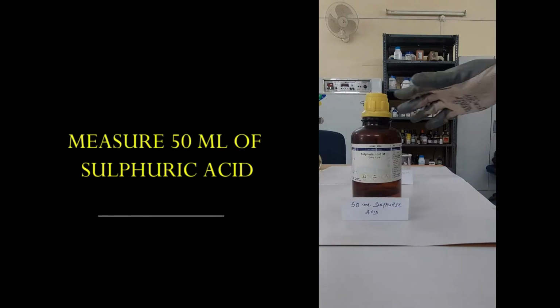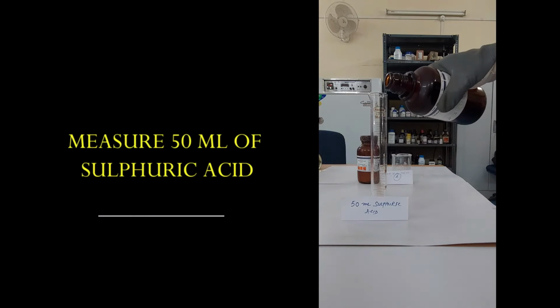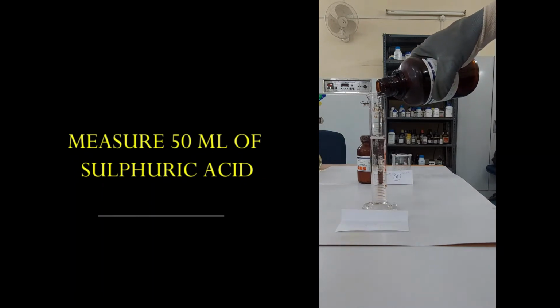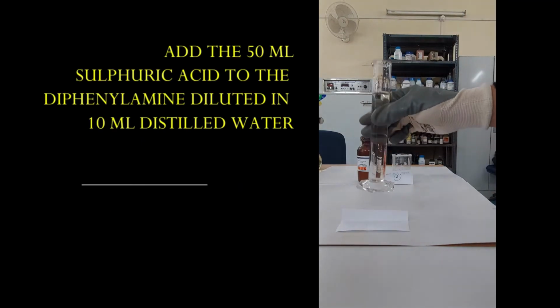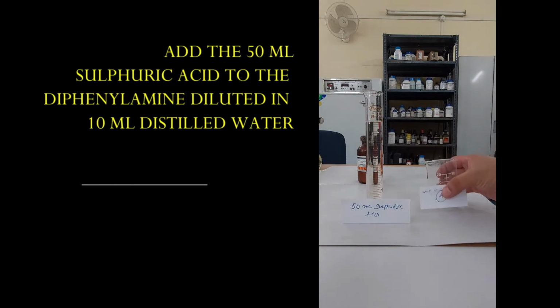And then measure 50 ml of concentrated sulfuric acid using a measuring cylinder. And now add the 50 ml sulfuric acid to the diphenylamine diluted in 10 ml of distilled water.